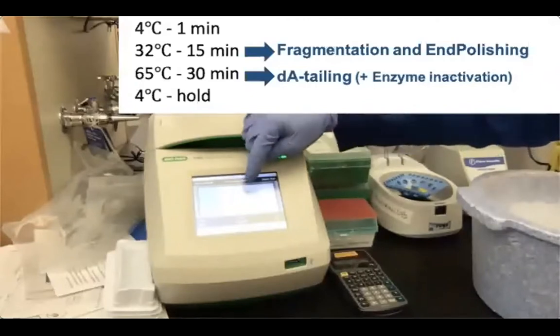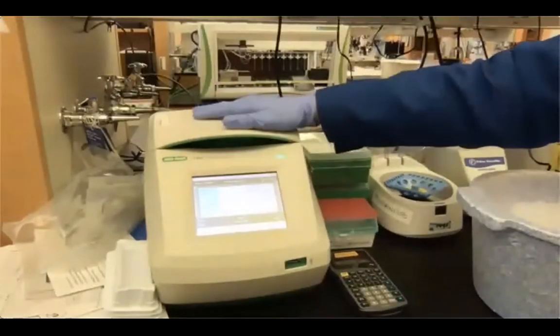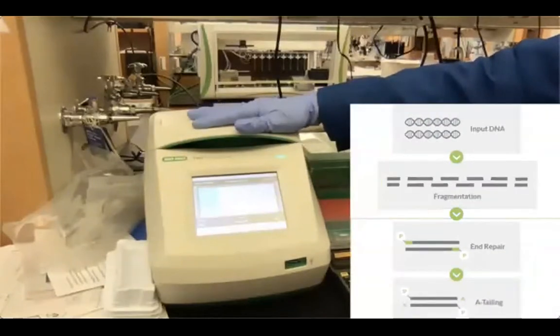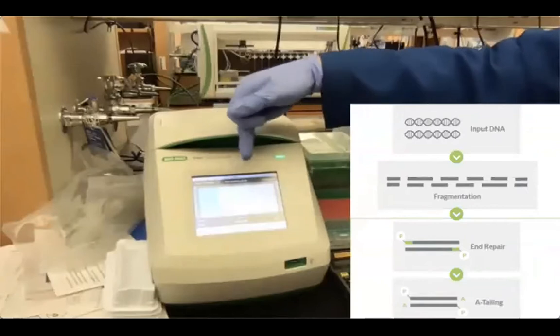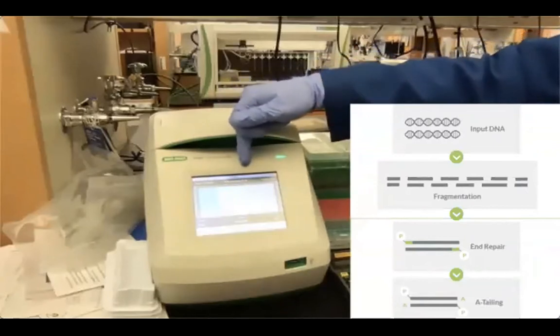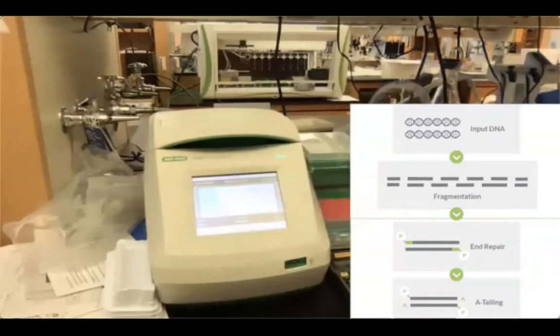And then at 65 degrees, we are going to have A-tailing, okay? So the product of this step is fragmented, repaired, phosphorylated DNA with an A-tail added to our products, and then we are ready for adapter ligation, okay? So it's going to take about 50 minutes.